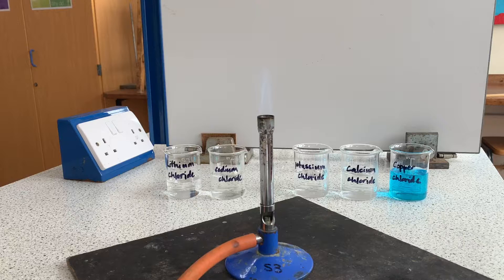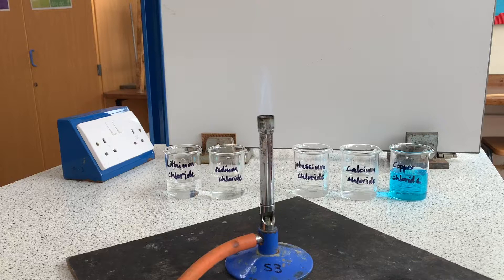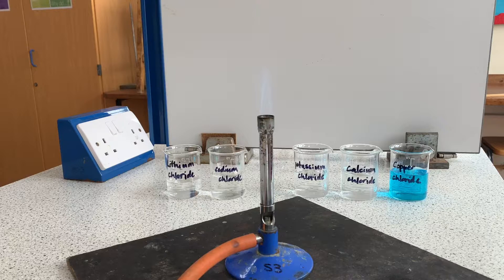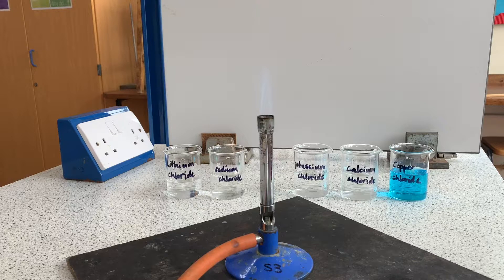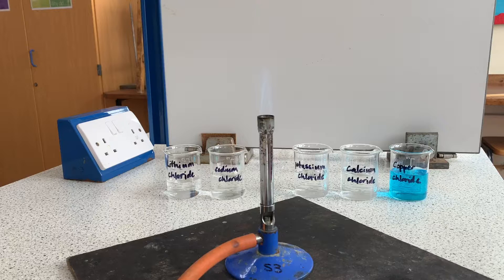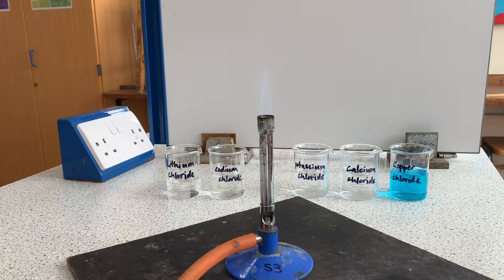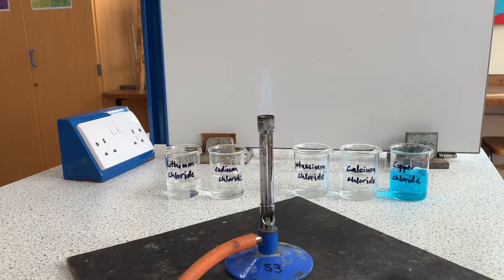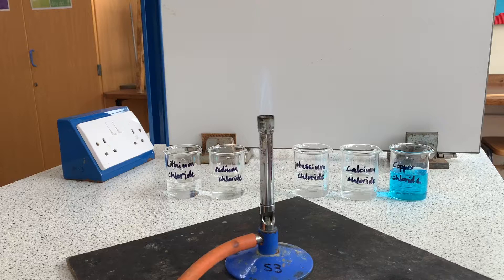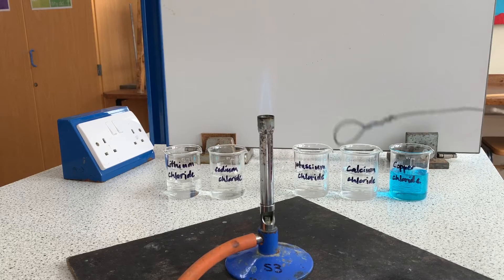Different metals will cause the flame to appear different colors and in the instructions for this practical you're given the colors that you should see for each of these metals. They are green, crimson, lilac, yellow and red.